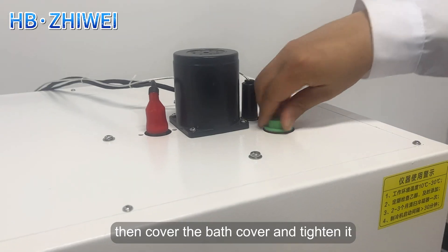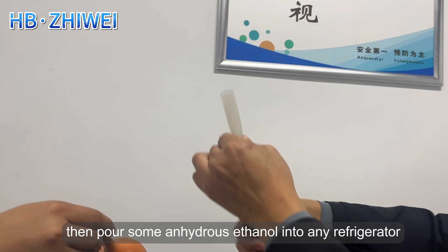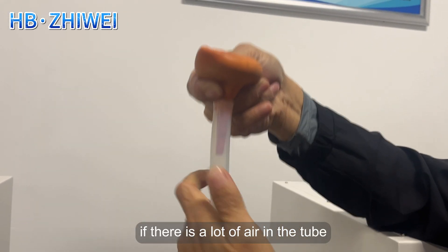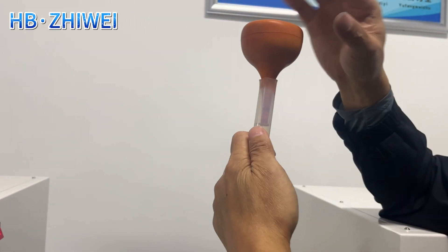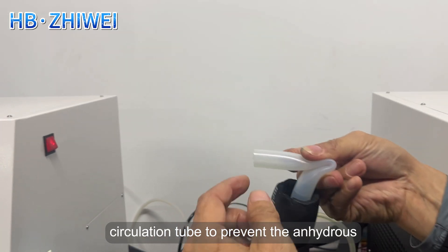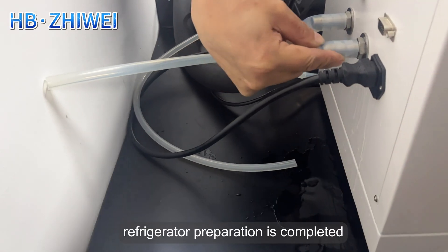Then cover the bath cover and tighten it. Pour some anhydrous ethanol into the refrigerator circulation tube, then use a cleaning ball to remove excess air in the tube. If there is a lot of air, repeat the operation several times until the anhydrous ethanol flows out. Bend the refrigerator circulation tube to prevent the anhydrous ethanol from flowing out, and then insert it into the connection port on the back of the test host. Refrigerator preparation is completed.